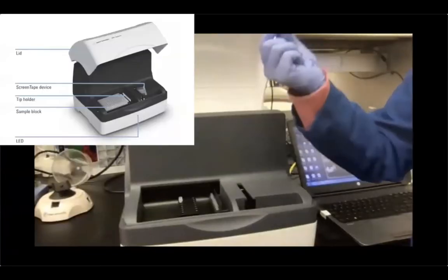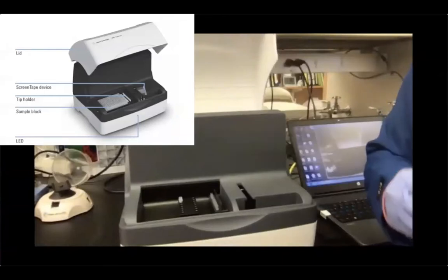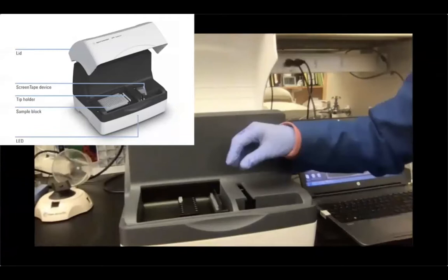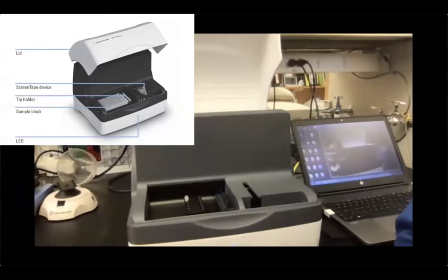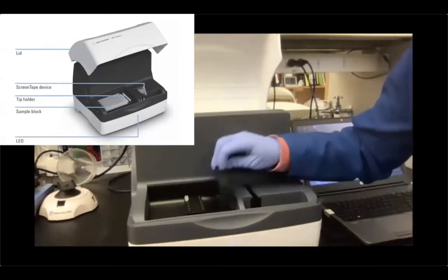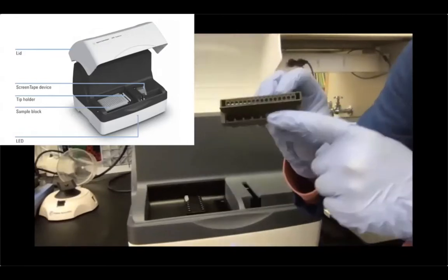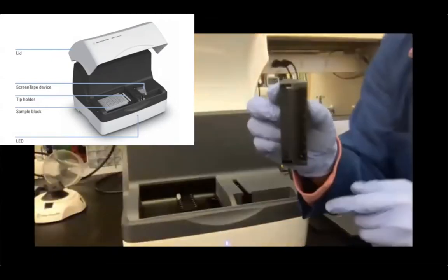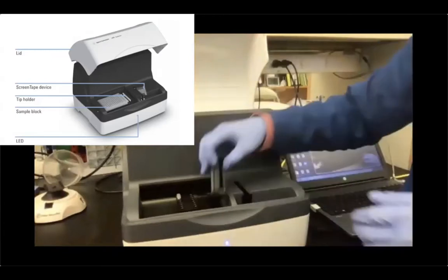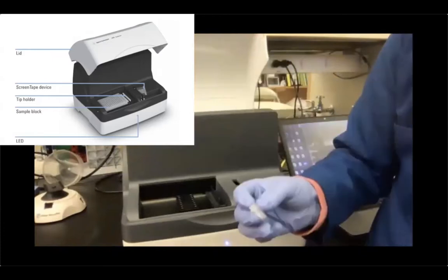We are keeping this tape because we still have some unused lanes. So I'm just going to put it back at 4 degrees. Also, I'm going to collect the unused tips and put them back in the tip holder, and then I'm just going to empty. I don't know if you can see it. You have 2 tips here, the ones that we've used. I'm just going to empty them in the trash, and now it's clear. Okay, so no tips whatsoever. And then our samples have been run already, so we can just discard them.